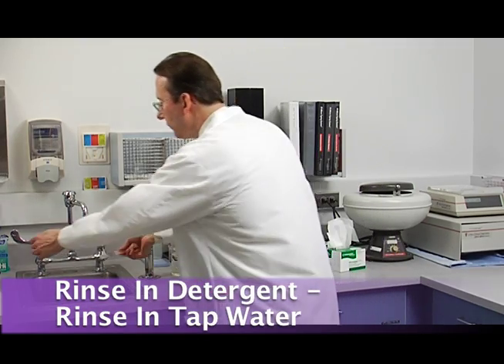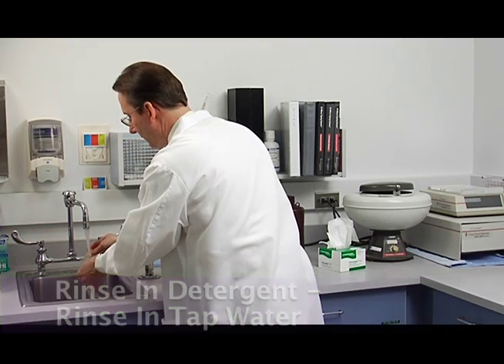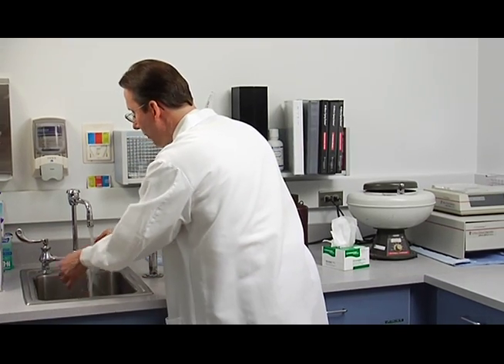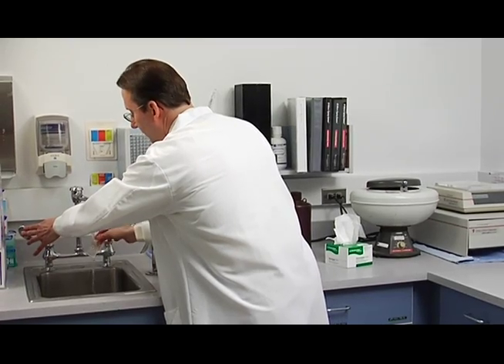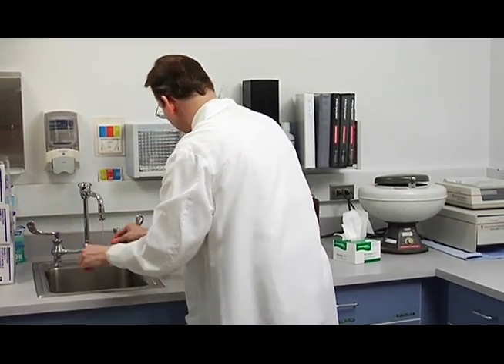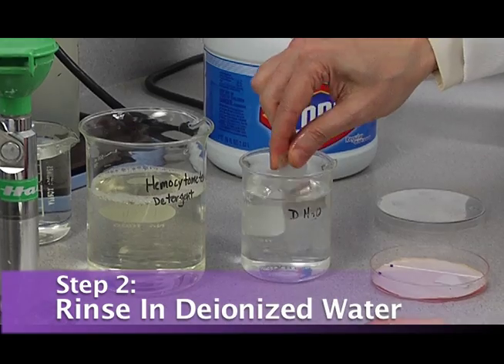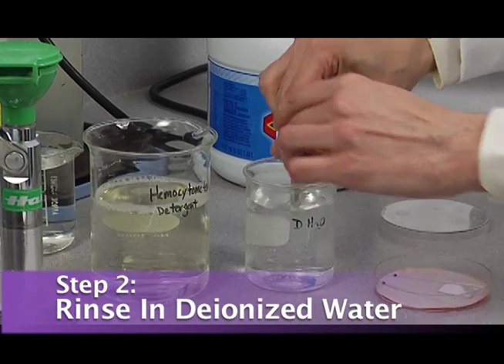Then you're going to rinse it off in tap water. I use warm tap water. It cuts the detergent a little better. And then rinse it in deionized water, just like this.